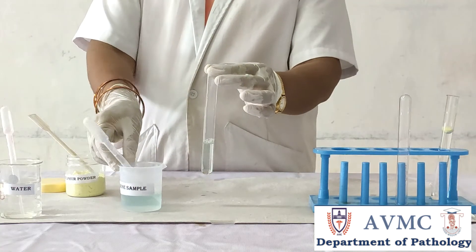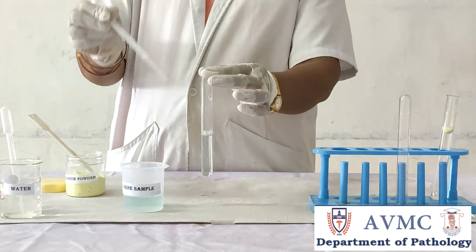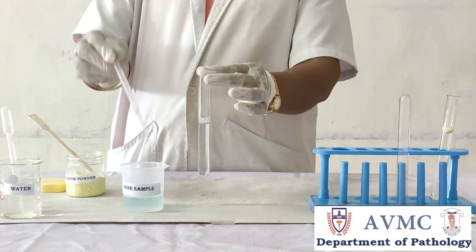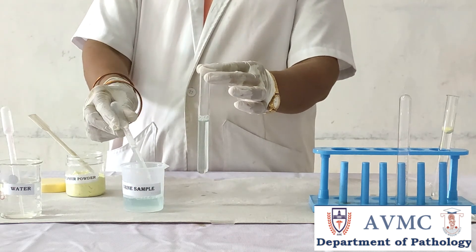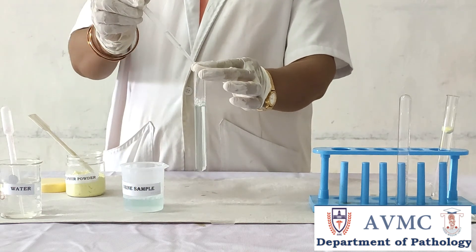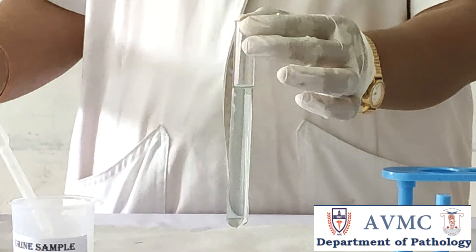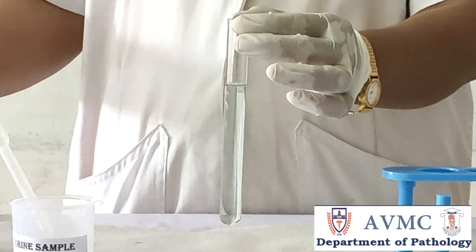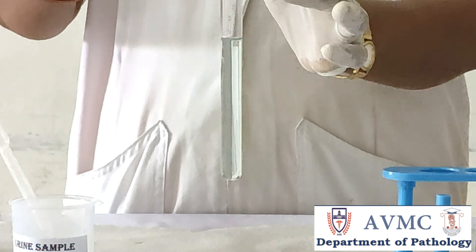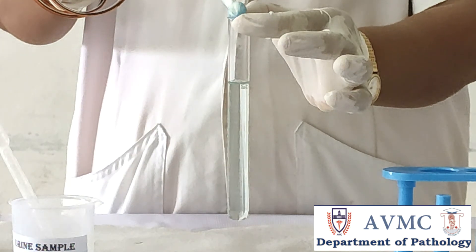Then take another test tube and fill it up to two-thirds with urine sample. Now add a pinch of sulphur powder into it. The sulphur powder sinks inside the urine sample.